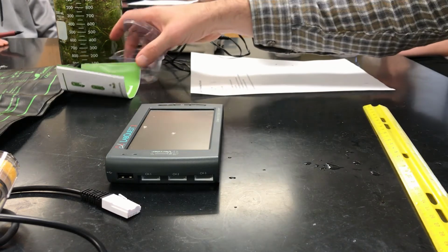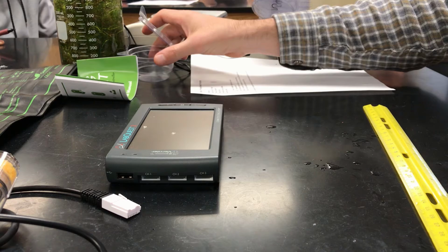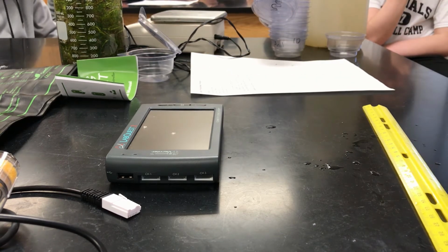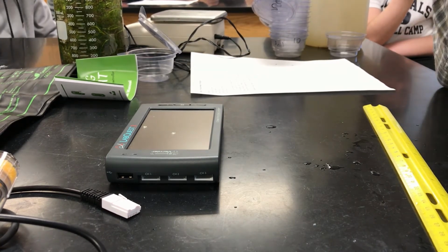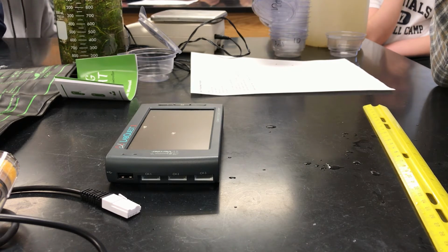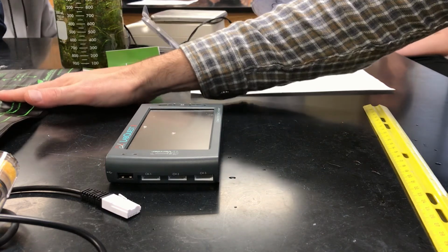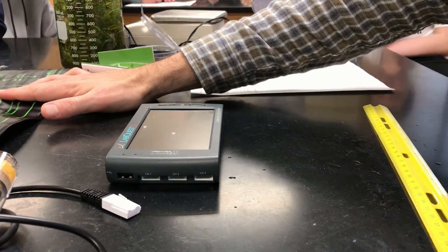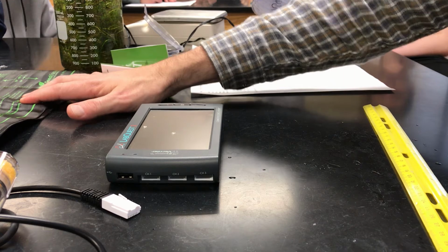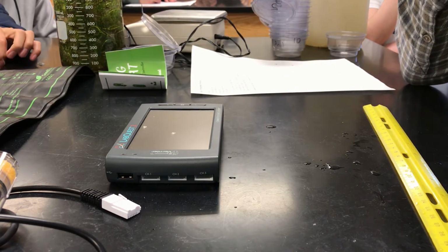All right, so we've talked about the Elodea. We talked about the closed containers. What is the experiment you're going to do? Well, you're going to see how photosynthesis changes with temperature. And the way that we're going to do that is we are going to use these heat mats. We have several of them, okay? And we are going to decide to change the temperature, and we can control the temperature of these.